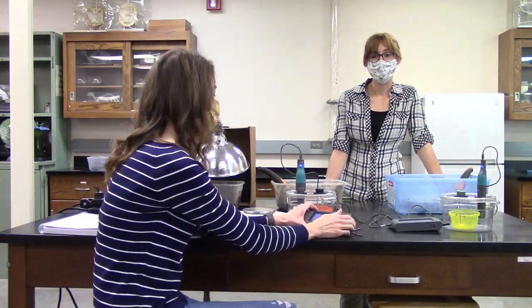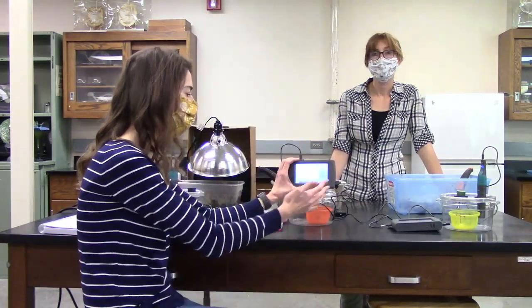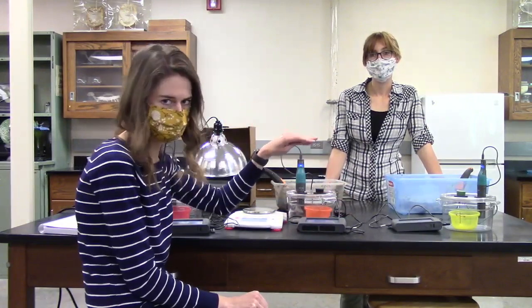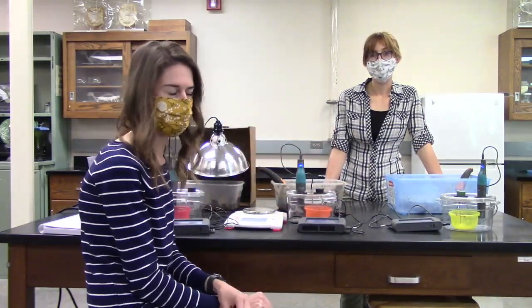So what you're going to be able to do is have a graph from each of these, which would give you a slope that you can find by just highlighting a portion of that graph to see how much the CO2 changed. So we'll give you some baseline data with an empty chamber, and it should be basically a flat line, so no change in CO2 throughout that. And we're going to add soil to each of these 3 chambers and see what happens in each of our treatment types.